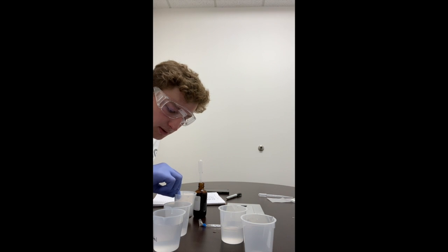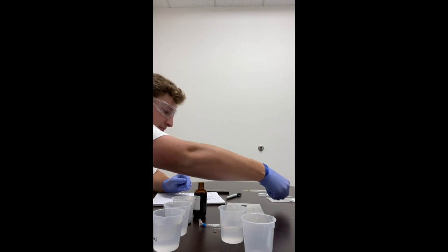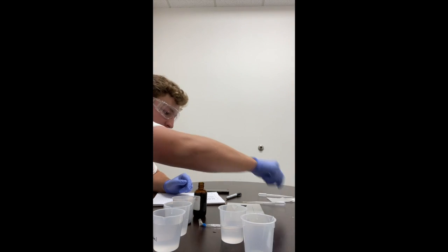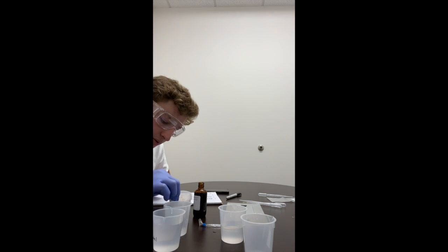We'll make sure we get it mixed around, and we'll see what color it turns. And after a minute, it has turned.